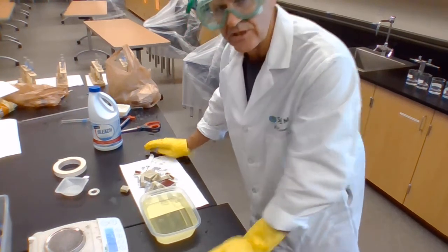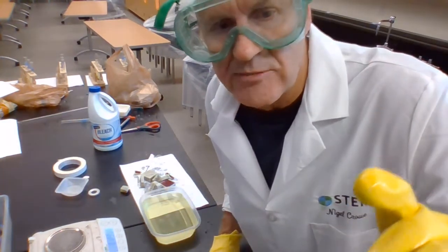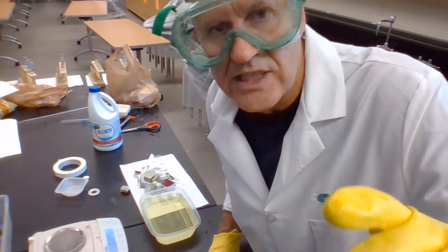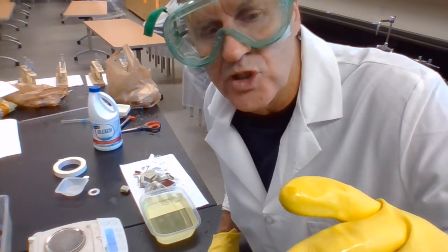It's a really simple demonstration, I know, but it's quite a good demonstration of the importance of surface area to volume ratio, and more than that, maximum diffusion distance.